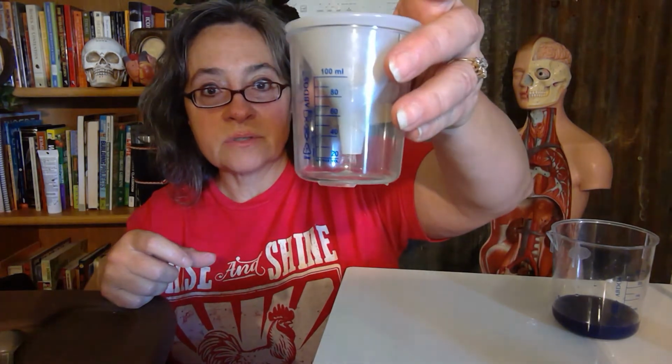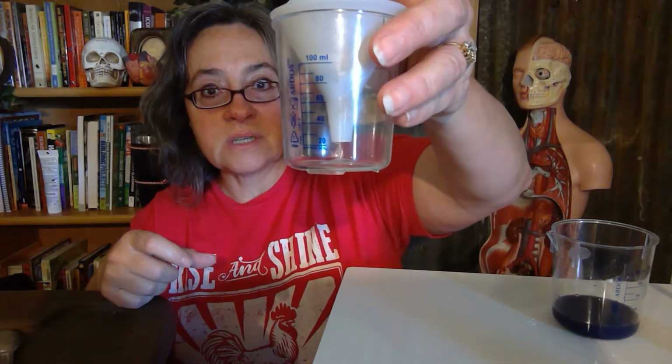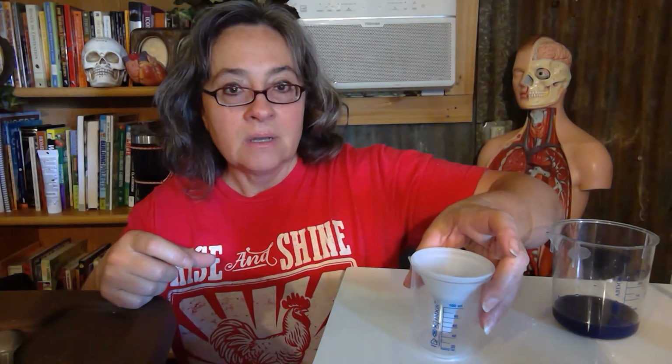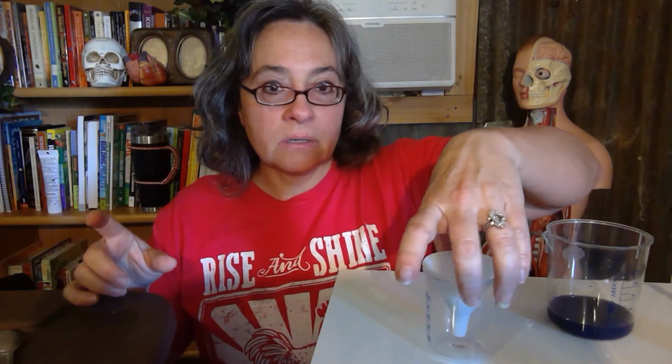I'm going to hold it close up to the camera so you can see it dripping out. And I want you to pay attention to the color of it. That's why I have it sitting on this whiteboard so you can see that. Let me turn it. So pay attention to this liquid that's dripping out. I poured this dark liquid in, and what's coming out now through the filter paper is clear liquid.